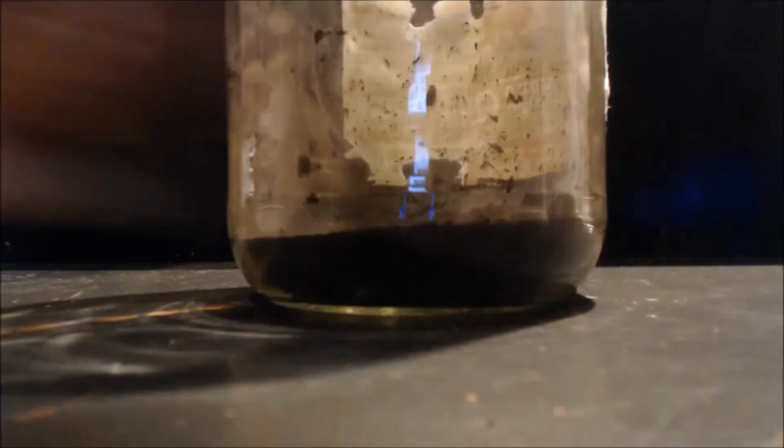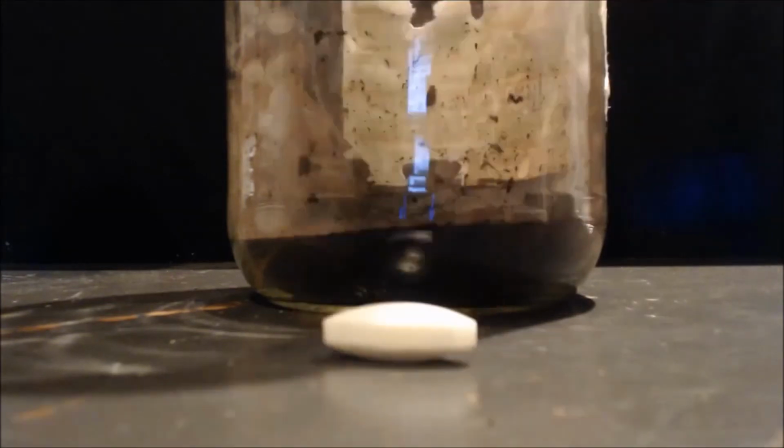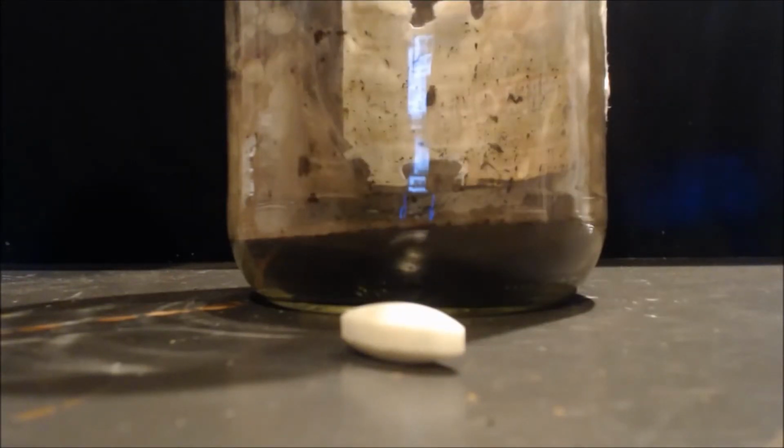Basically, I'm going to put this stir bar in, which I found too. I moved the dresser out, or desk, or whatever you call it, in the kitchen, and there it was underneath. I found one. I started out with 7 stir bars. A good tip, because this is how I lose them most of the time, is I filter them out, and then I forget them. I throw the filter out. Probably because when I'm doing it over and over, and I can't get the crap out, it gets you frustrated. And then you end up throwing your stir bars out in your filter paper.